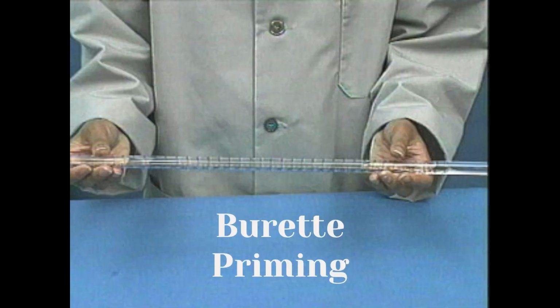Before filling the burette, we prime it with the titrant, meaning we rinse the inside with a small amount of the same solution that we'll be using for the experiment. This step removes any leftover water or impurities that could dilute the titrant and affect our results. Once the burette is fully coated with the correct solution, we can fill it confidently knowing that every drop delivered during the titration has the proper concentration. Priming the burette ensures consistency within our final measurements.